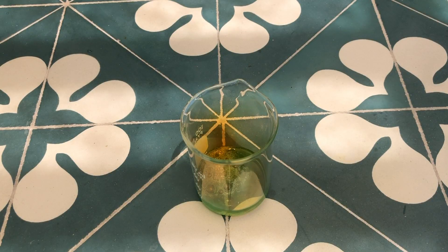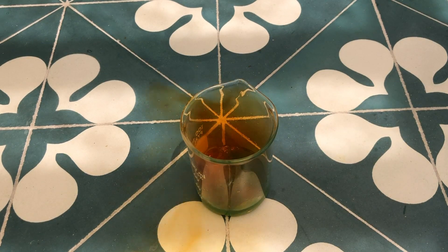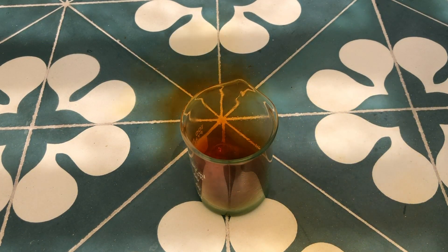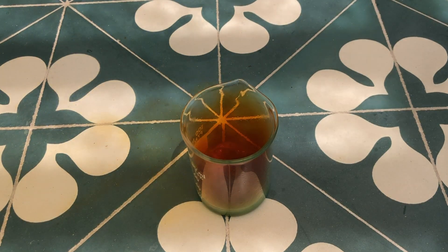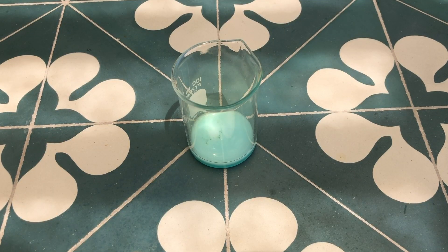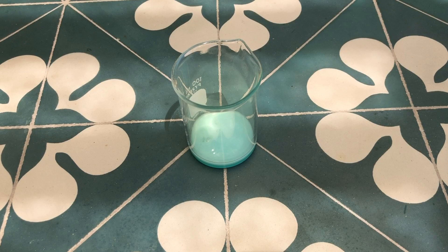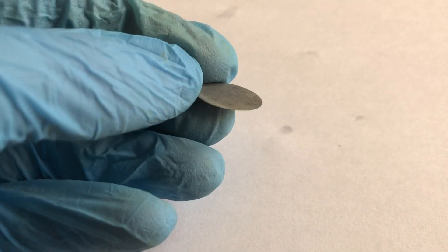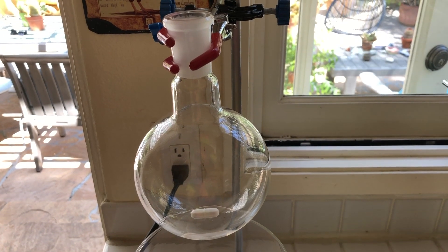At this point, I got impatient and decided to show my friend nitric acid dissolving a penny. This will make yield a bit harder to calculate, but I did it anyway. The solution turned a really nice turquoise color after the reaction was done, and I was left with a very thin and sharp zinc penny core.